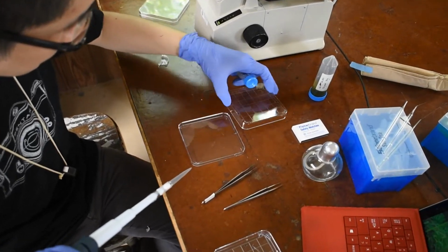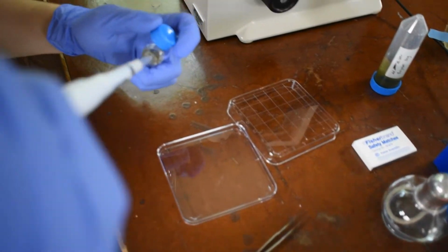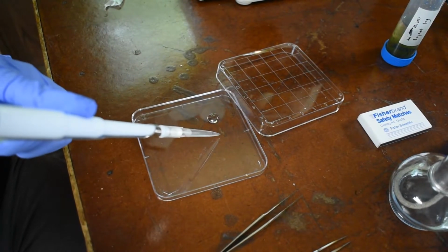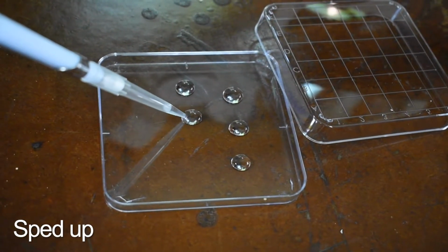Dr. Cito then adds drops of autoclaved and UV radiated deionized water with a P1000 pipette to the cover of a sterile petri dish. The chytrid sample will be cleaned by serially transferring it from one drop to the next.